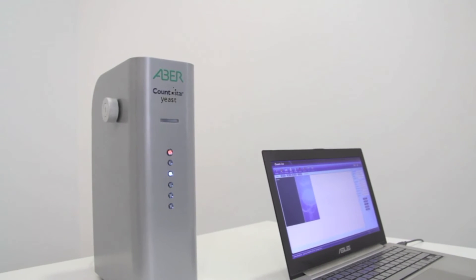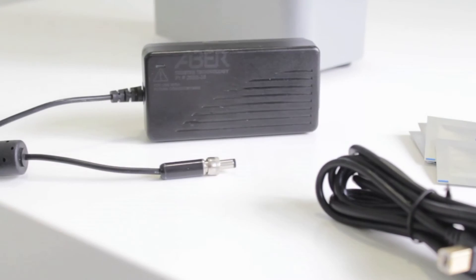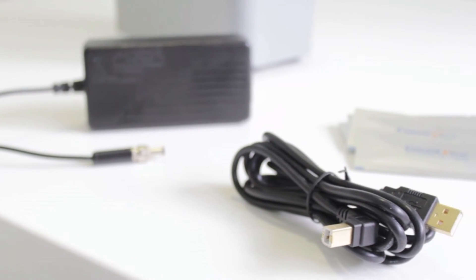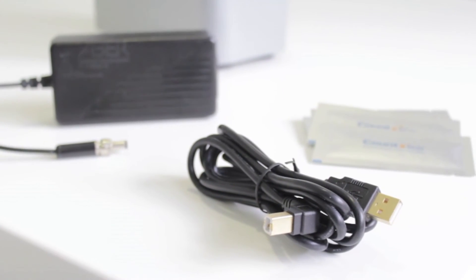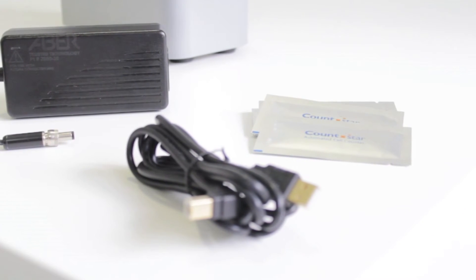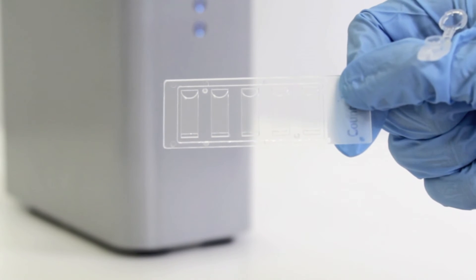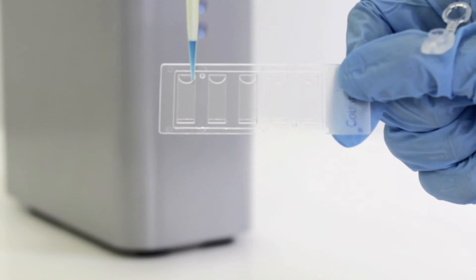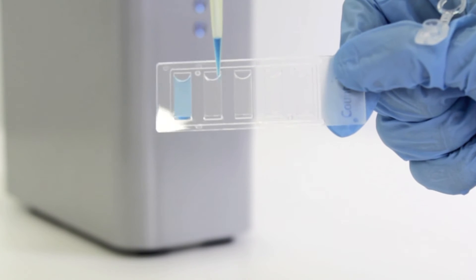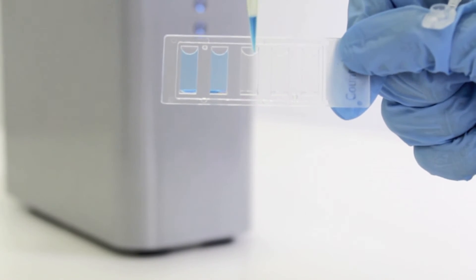Let's take a closer look at the system. It includes the main instrument, a power supply, a USB lead to connect to the computer, the CountStar yeast software, and the CountStar slides. The CountStar yeast uses specialised disposable slides with five chambers in which the stained samples are placed for analysis. Having five chambers means you can use one slide to analyse five samples.